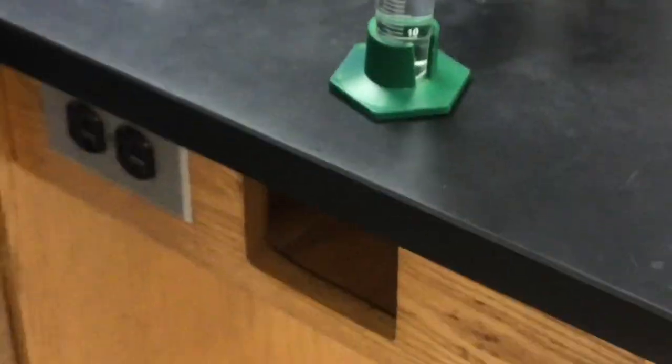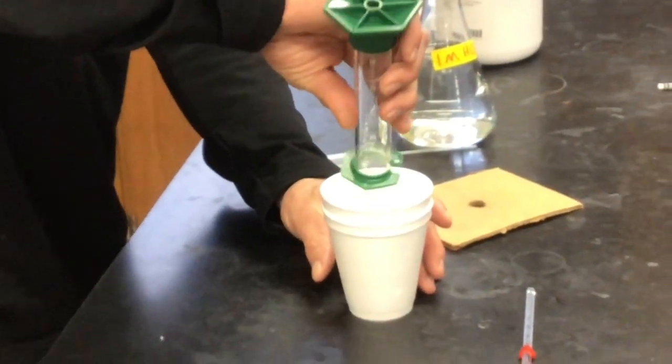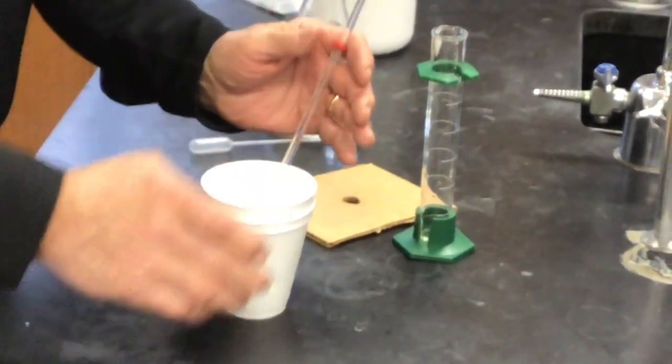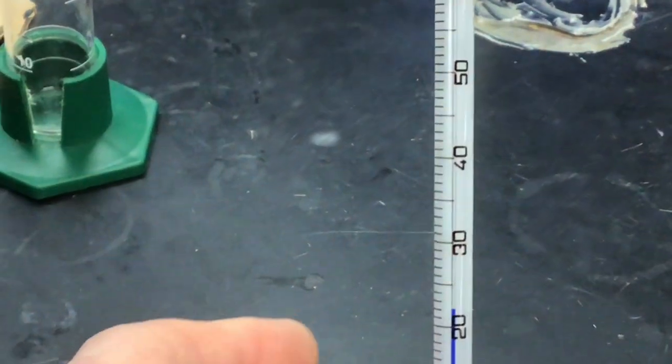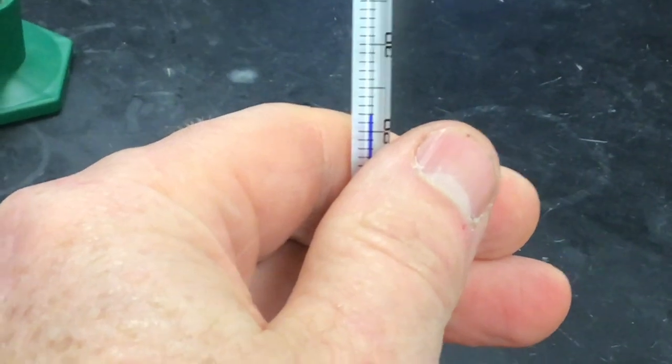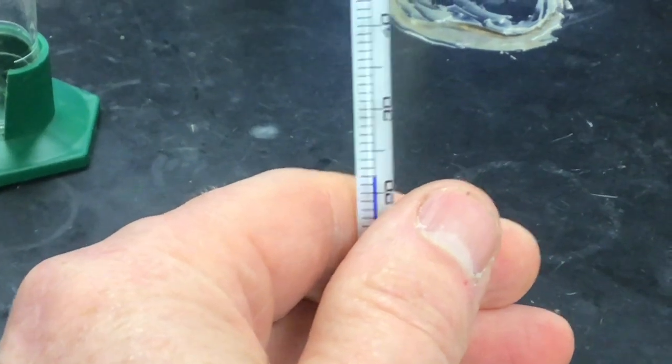Whole milliliter, right? So, what do you report the volume as? That's good. So, we're going to dump it in our high-tech calorimeter. That does look like precision lab equipment. There will be our initial temperature. I'm going to rotate this just a little bit so we can get the mark above. Initial temperature.